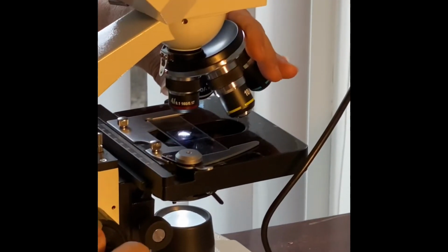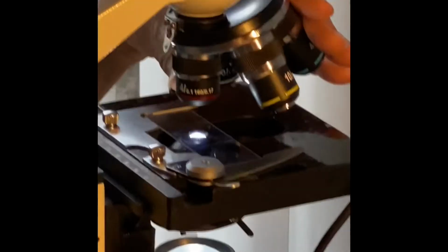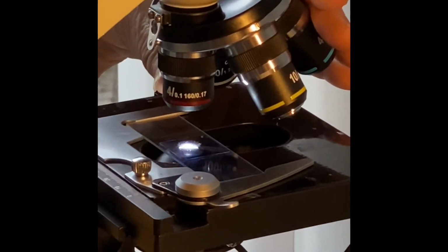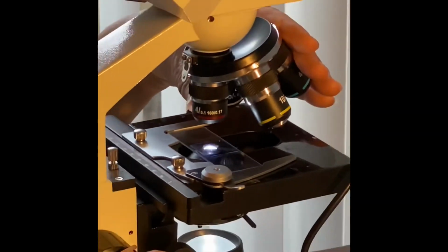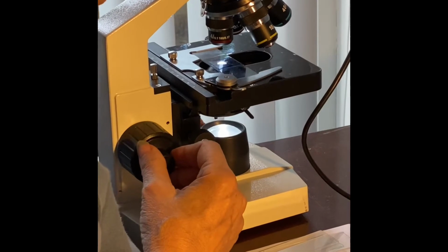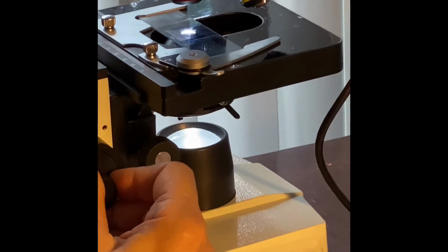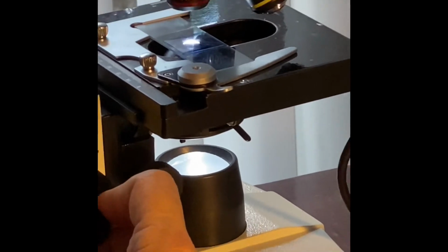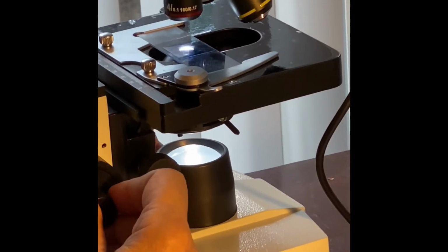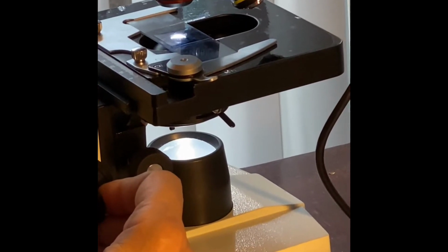Now you're ready to look at the specimen through your 4x objective, which is a total of 40x. You move the cells up and down, and find a cluster of cells. A lot of the cells will be overlapping, but you find an isolated cell that is squamous in appearance, slightly oval.